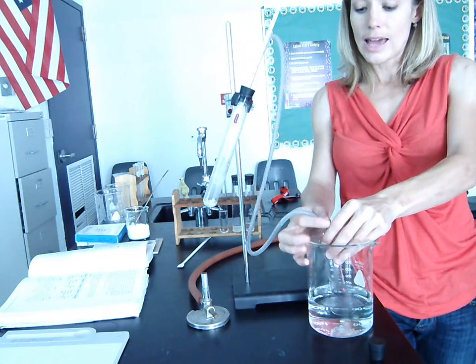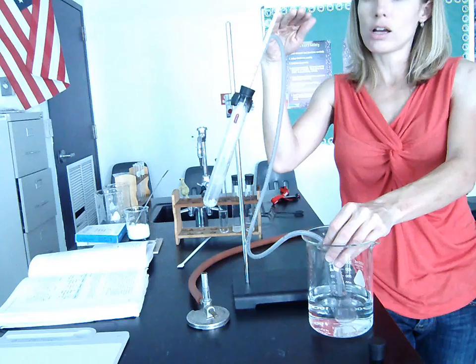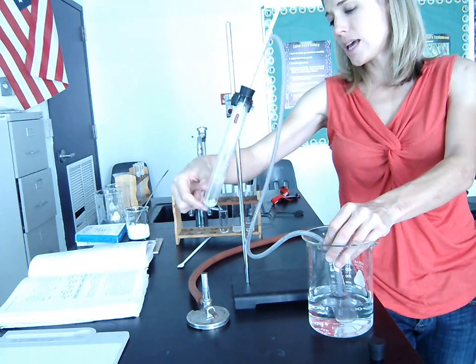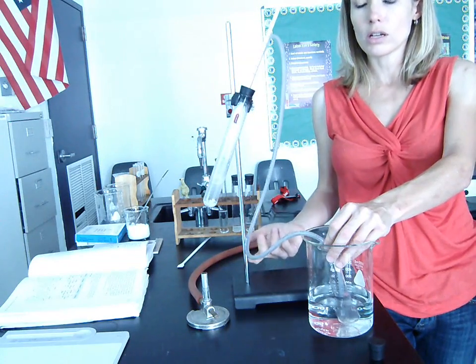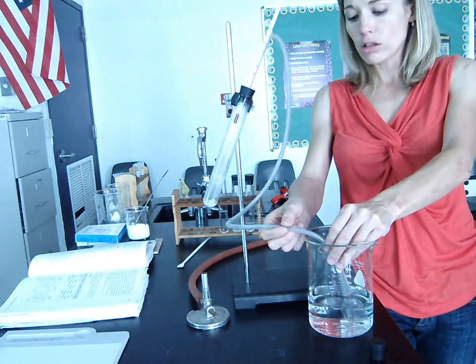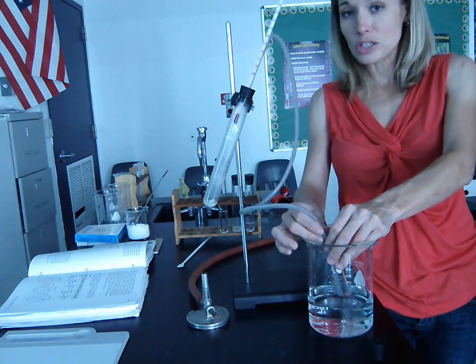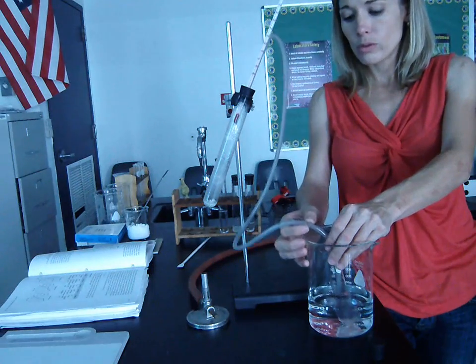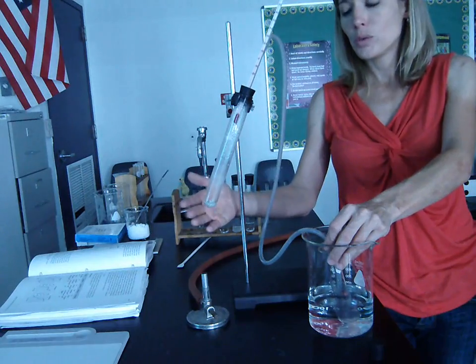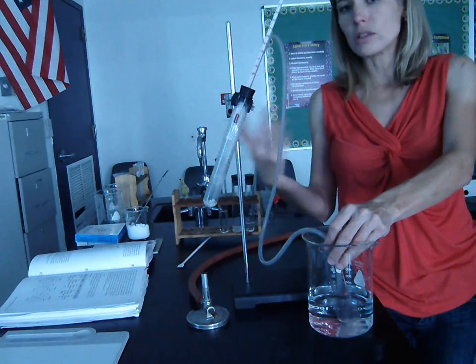So now, at 100 degrees, we'll notice a second plateau. We'll notice that the temperature stays at 100 consistently. At this point, we still probably have about 10 or 12 cubic centimeters of our solution left over. And all of that should be water, or our substance that boils at 100 degrees, which is water. And so we're basically going to wait until almost all of it has boiled off. We don't want to wait until all of it's boiled off because we don't want to break the test tube, but we want to make sure that most of it's boiled off.